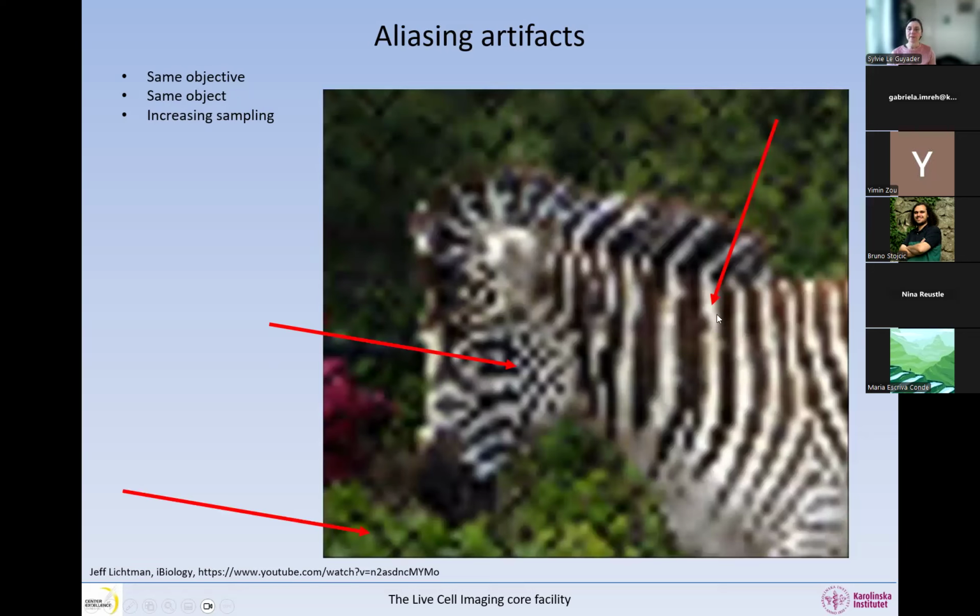So as you can see, when we sample a little bit more and we have smaller pixels, then this disappears. However, in here we get a new one. So we get a checkered cheek on this poor zebra. And this does not happen in nature either. And all these wavy patterns like this do not happen. And then you can see in the background we have a fence, and now we see all these molten-like little balls on the fence. This is also not true.